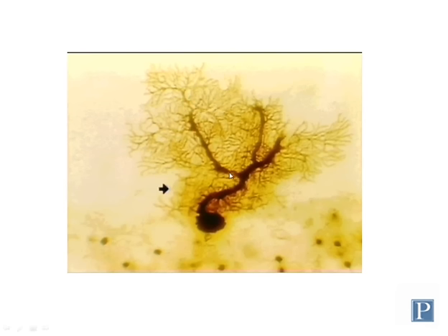The disadvantage of this method is it's much more expensive and labor intensive to produce, and it's very selective in staining, so it tends to only show a few neurons and not all of them. So if you were attempting to count the number of neurons or get an idea of cell density, this method isn't the best one for that.